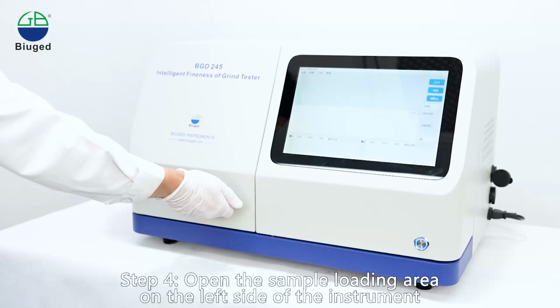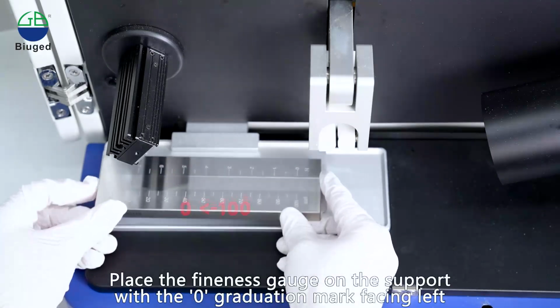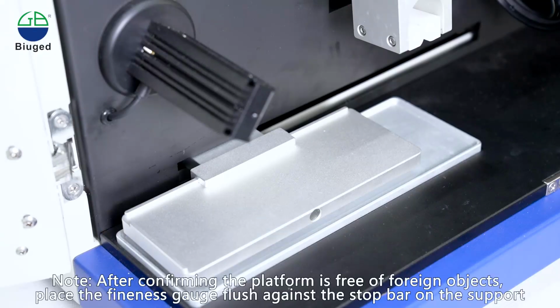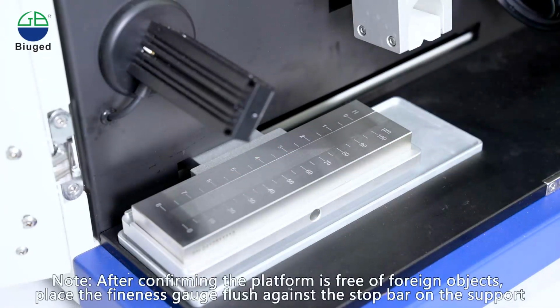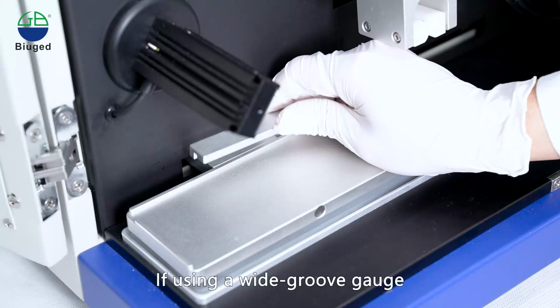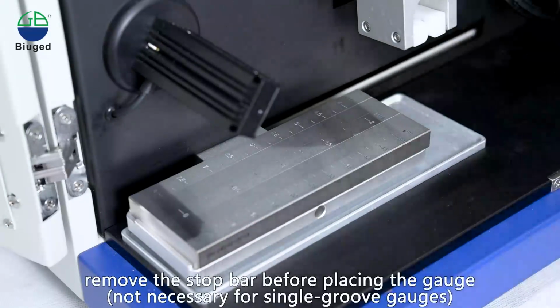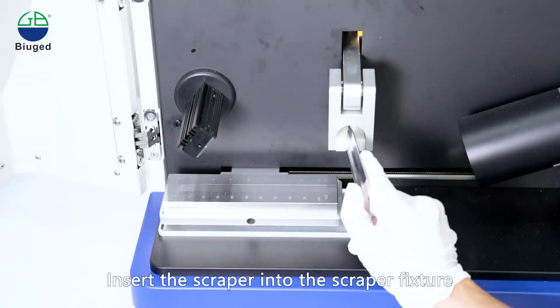Step 4. Open the sample loading area on the left side of the instrument. Place the fineness gauge on the support with the 0 graduation mark facing left. Note: after confirming the platform is free of foreign objects, place the fineness gauge flush against the stop bar on the support. If using a wide groove gauge, remove the stop bar before placing the gauge. Insert the scraper into the scraper fixture.